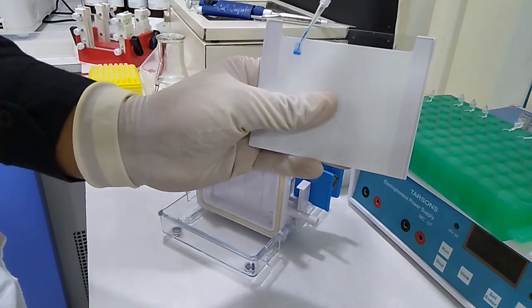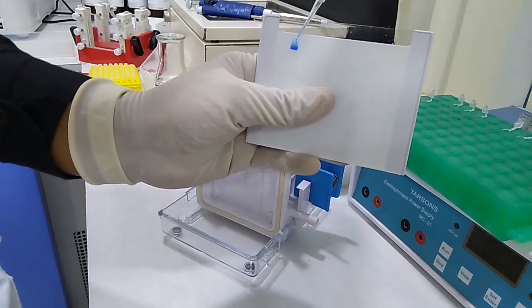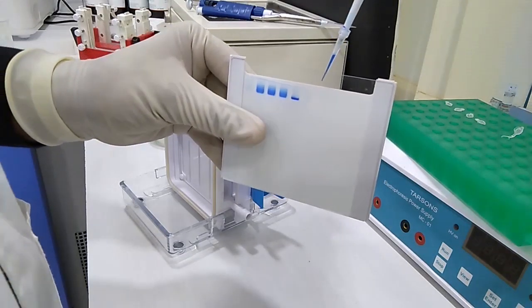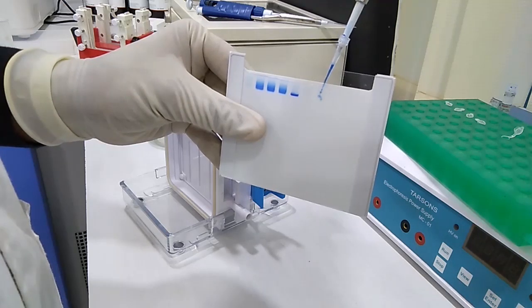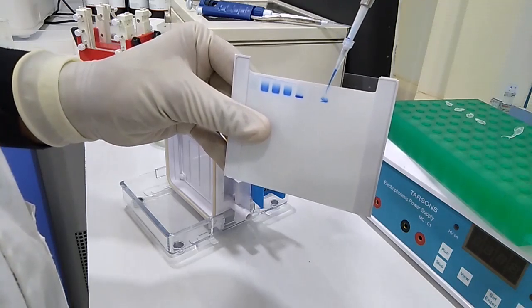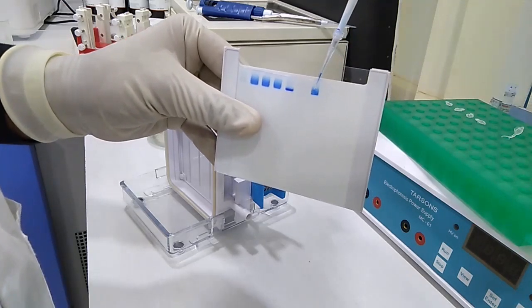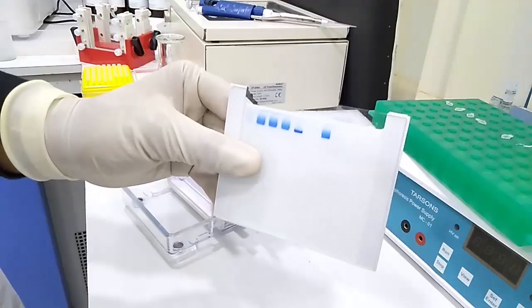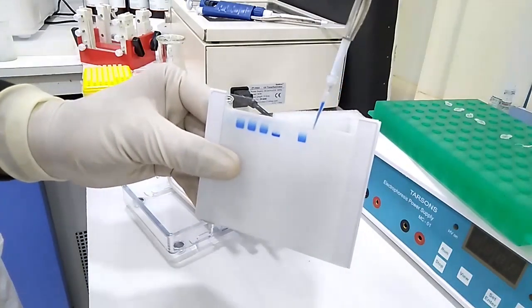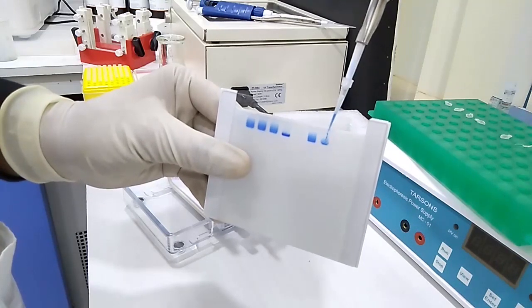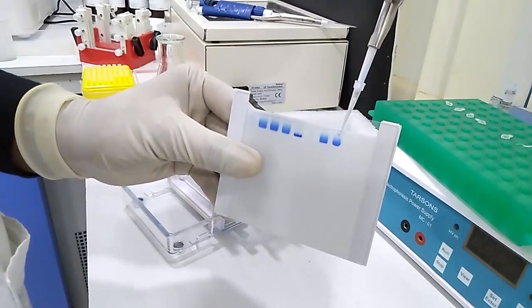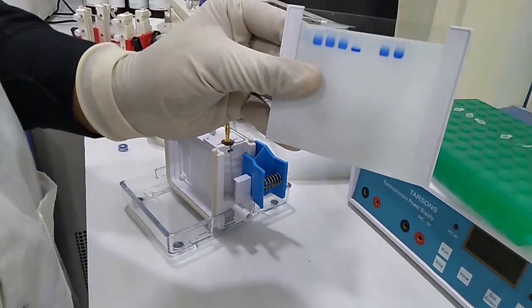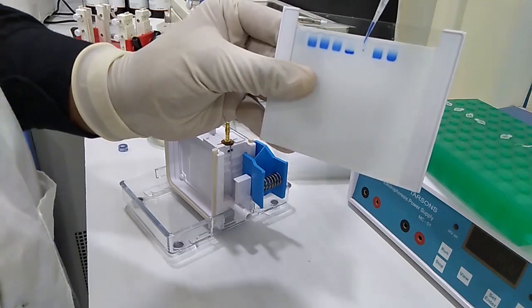Carefully make sure that gel will not overlap to the another well. We are loading the sample into the gel carefully. Make sure that will not overlap in the another wells. We are loading our final sample here, carefully. Now I am loading 100bp ladder here.